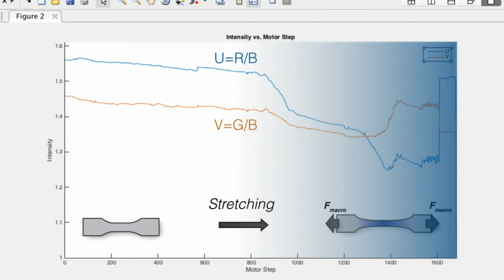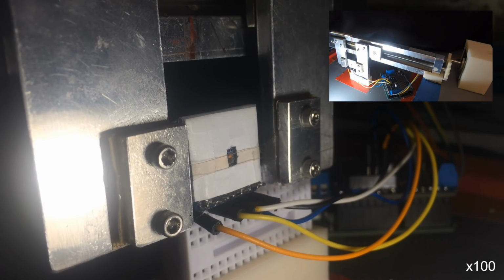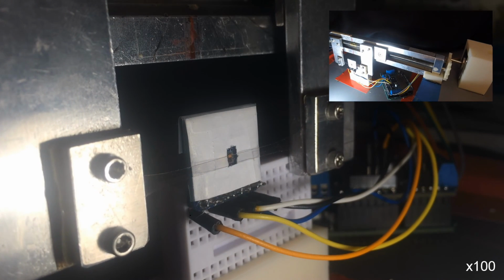As you can see from this plot, when the film changes color, U, shown by the blue line, decreases, while V, shown by the red line, begins to increase. Shortly after the film turns blue, U becomes lower than V, so we have chosen the condition for extending the film as U greater than V, and the condition to relax the film as U less than V. The film can be repeatedly stretched until it turns blue and then returned to its initial length autonomously.